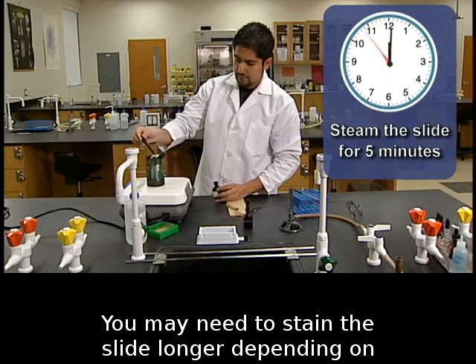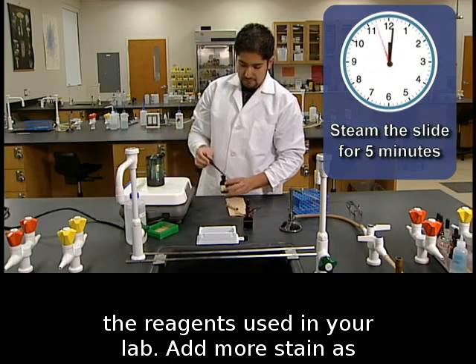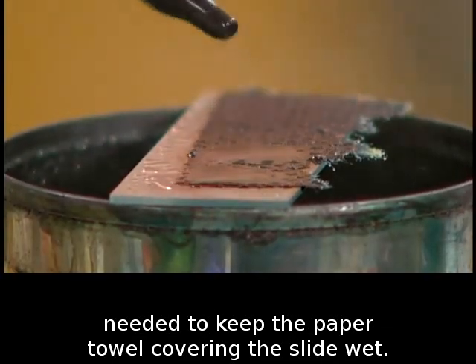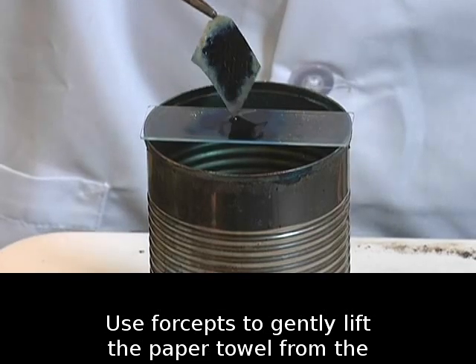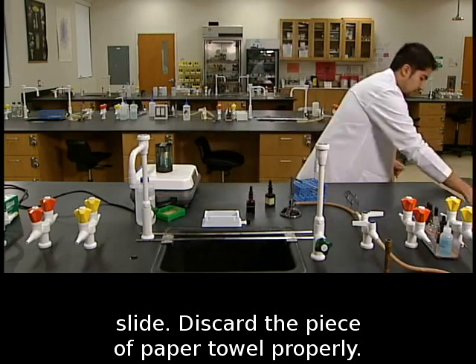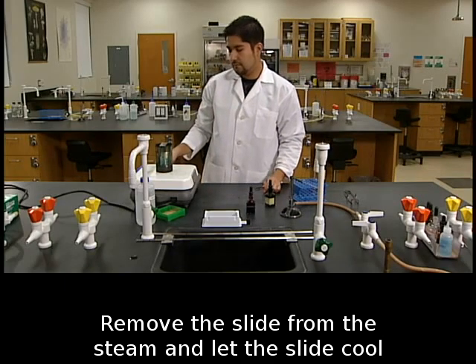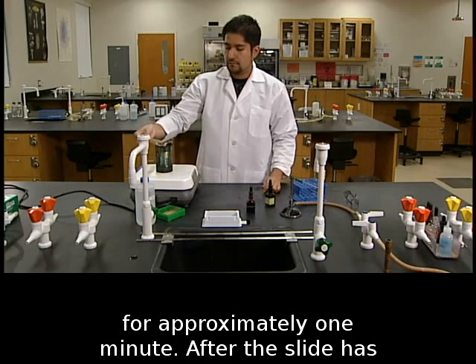You may need to stain the slide longer depending on the reagents used in your lab. Add more stain as needed to keep the paper towel covering the slide wet. Use forceps to gently lift the paper towel from the slide. Discard the piece of paper towel properly. Remove the slide from the steam and let the slide cool for approximately 1 minute.